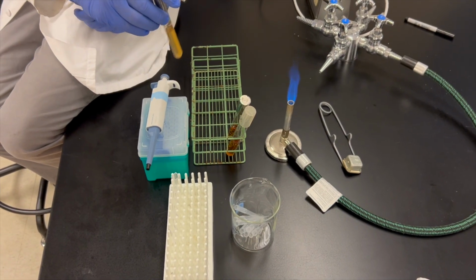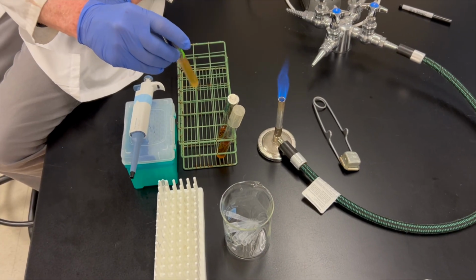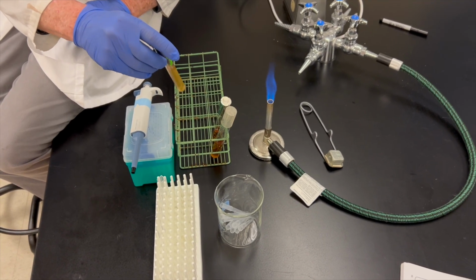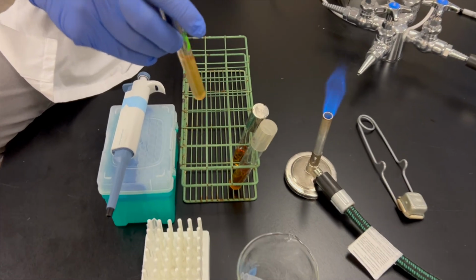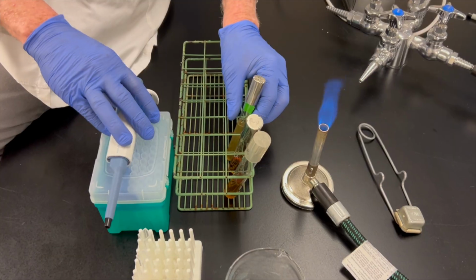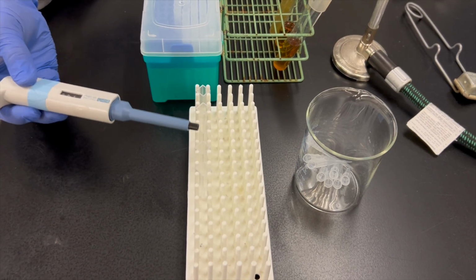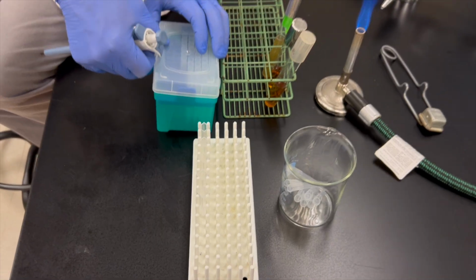So to start with then, I want to mix this up really well. We'll get in here and get this all mixed up. You can see it mixing up from the bottom because we want an even distribution of bacteria if we're going to get a good estimate in there, okay? Now what I'm going to do is put 1.5 mLs into each of these cuvettes. Okay, and we'll just start with that.